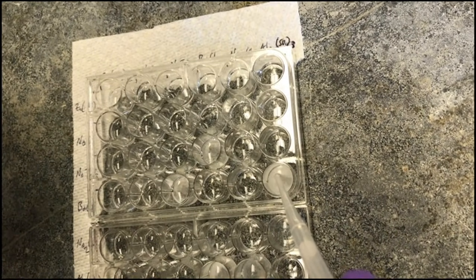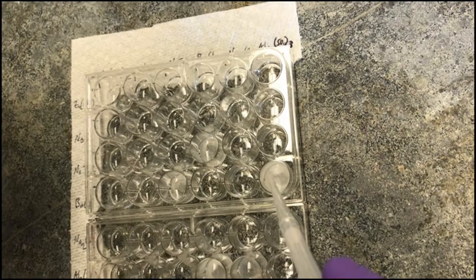You did not. I think that's it. All right, so now we give them a little shake. Yep. Here, let me just put this back in the test tube rack.